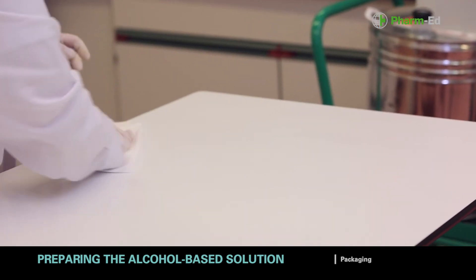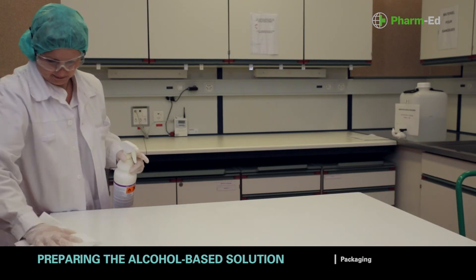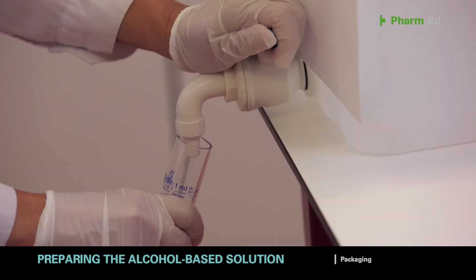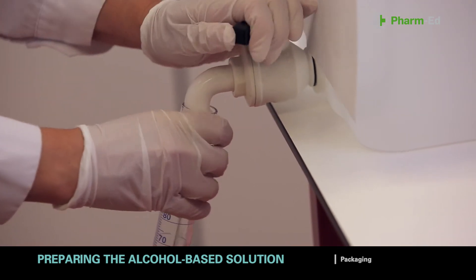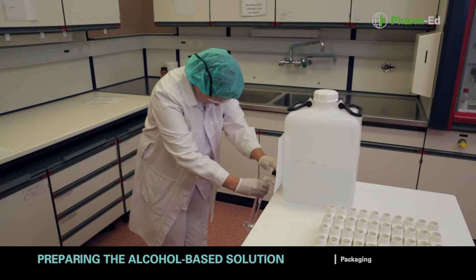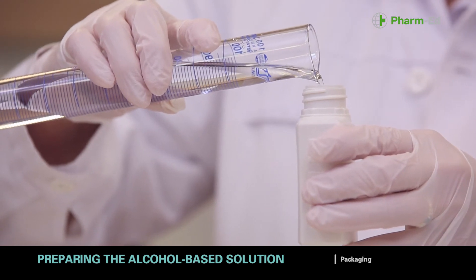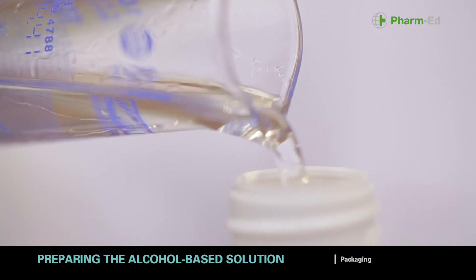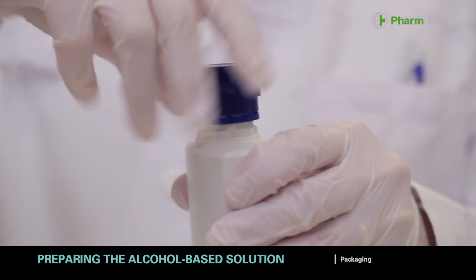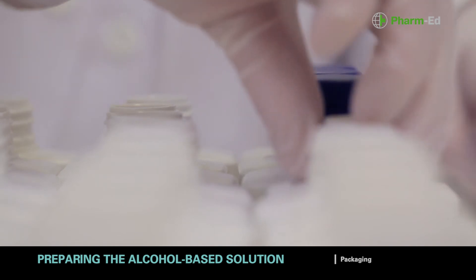Check that the factory line is clear; specifically, make sure that the workspace is clear of any equipment and clean it using alcohol. Get the individual bottles ready and check that they are clean. Fill in the production sheet for this stage. Distribute the solution into the bottles immediately. To do this, measure 100 millilitres of solution into a 100 millilitre measuring cylinder, then transfer this amount into the individual bottle. Close the bottle immediately by screwing the cap on tightly. Repeat these steps until all of the solution has been used up, then tidy up and clean the workspace using alcohol.